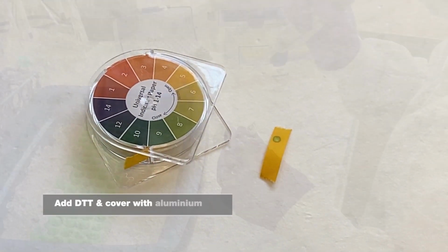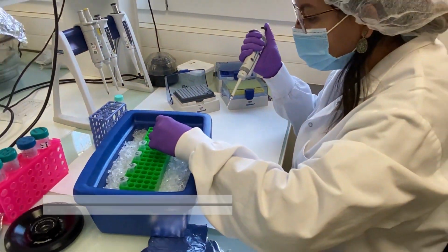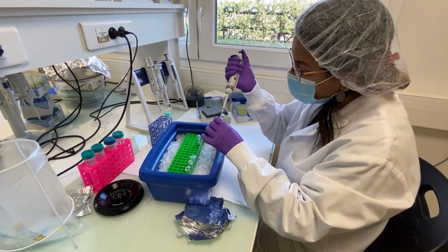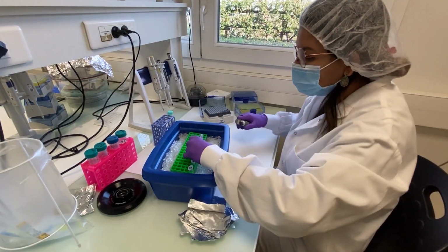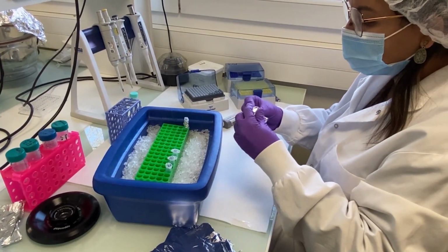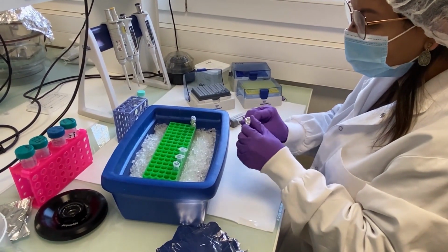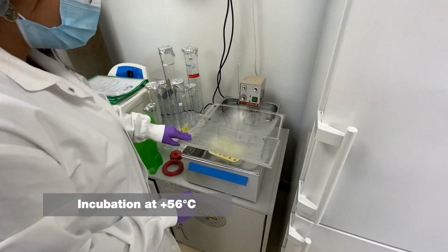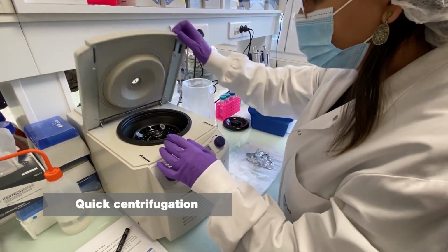Then, a volume of 2 microliters of a reducing agent is added to break the disulfide bonds present in some proteins. The reaction occurs in the dark for 45 minutes at 56 degrees Celsius. Afterwards, the samples are quickly centrifuged.